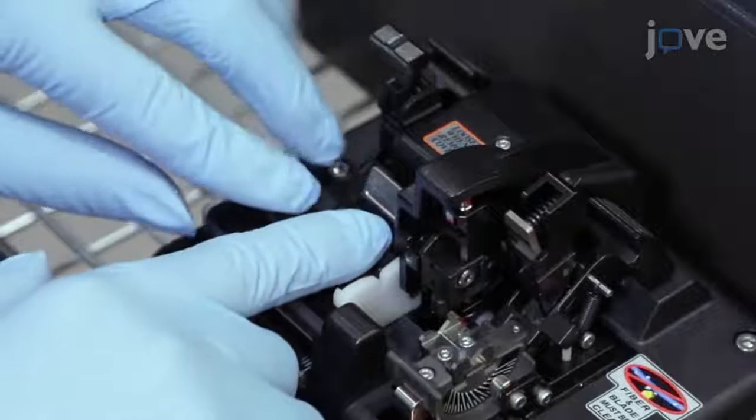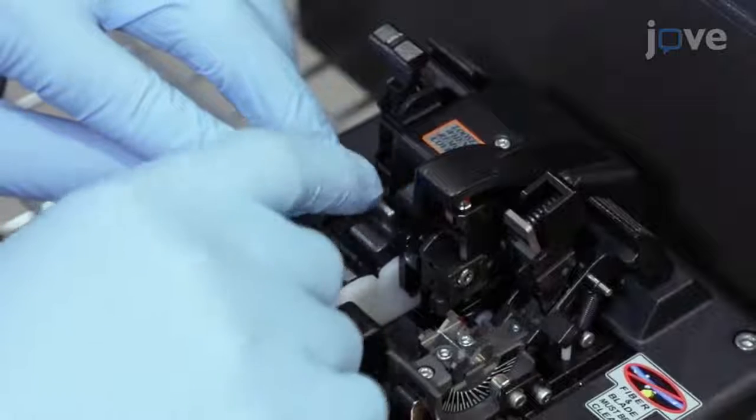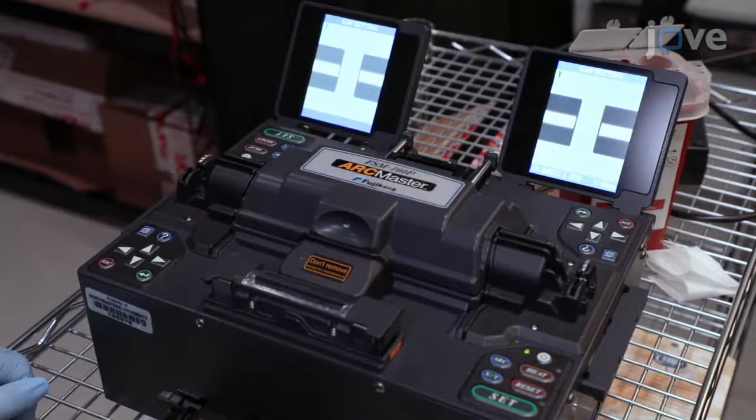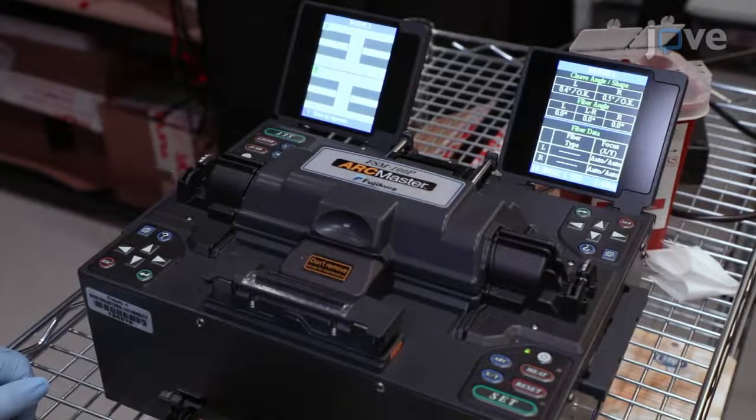Experienced personnel are needed to assemble and operate the laser. Some experiments appear to be unreproducible because it is very likely to miss some untold details when following written instructions. In visual demonstration, the viewers won't miss anything.